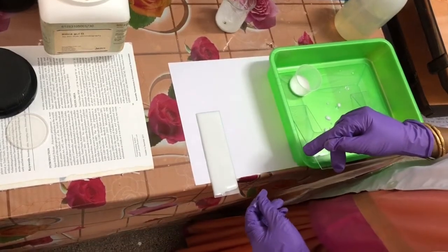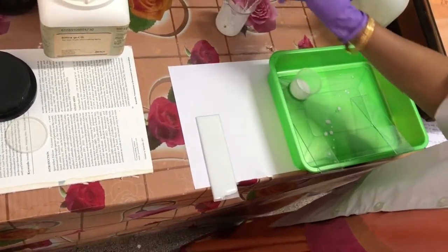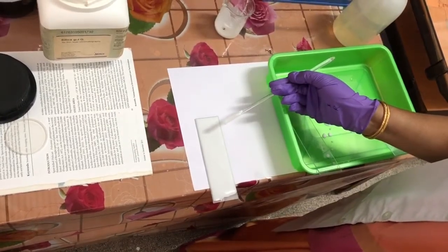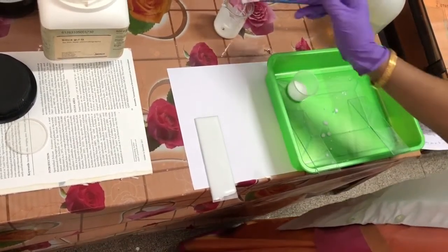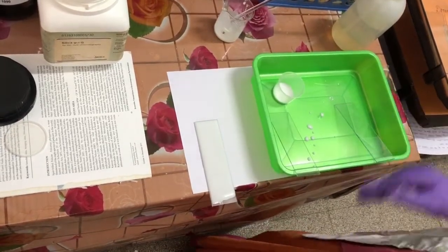This plate has silica gel coated on glass — this becomes the stationary phase. The solvent will be the mobile phase. This is how you prepare a silica gel plate for thin layer chromatography.